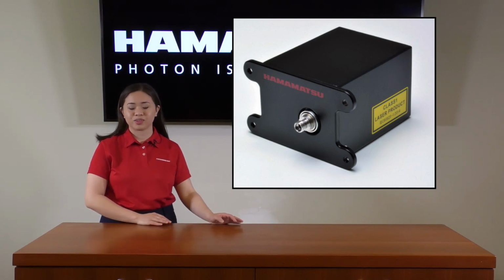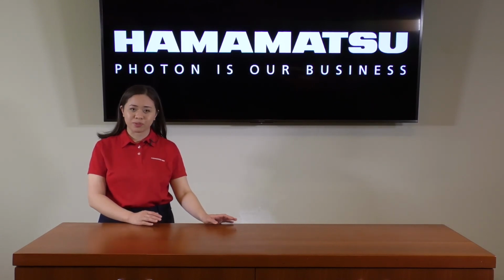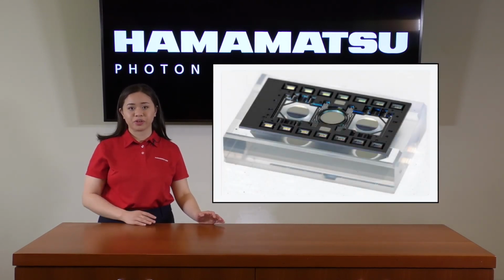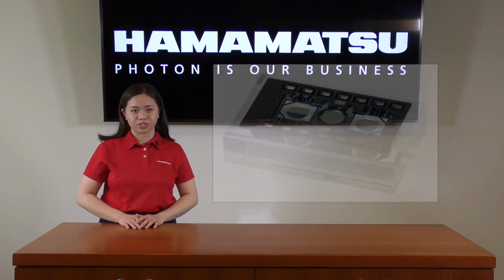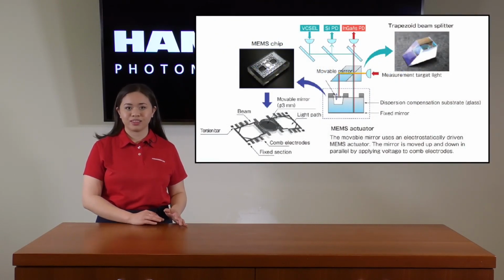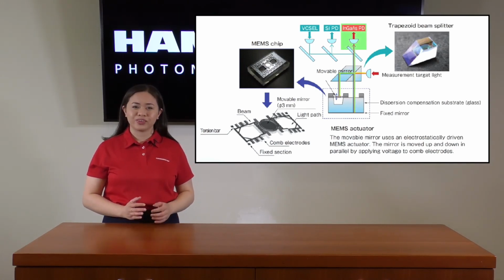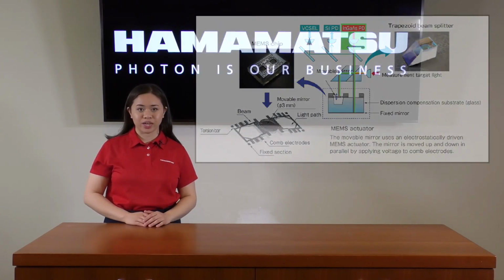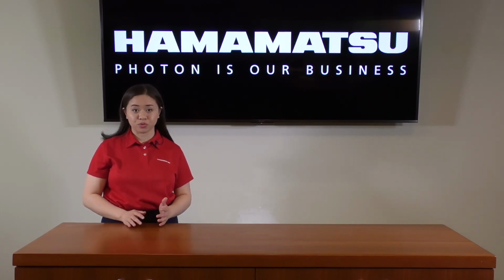This spectrometer utilizes a Michelson interferometer to scan across the NIR. We've designed this spectrometer to integrate the movable mirror and the fixed mirror into a single MEMS chip, ensuring reliability in measurements and stability in operation. Measurement signals are input to the FT-NIR engine through the collection lens and then focused onto the beam splitter. This light is then directed onto the movable mirror and the fixed mirror. The light reflected from the mirrors then rejoin at the beam splitter, and their interference signal is detected by the InGaAs photodiode.